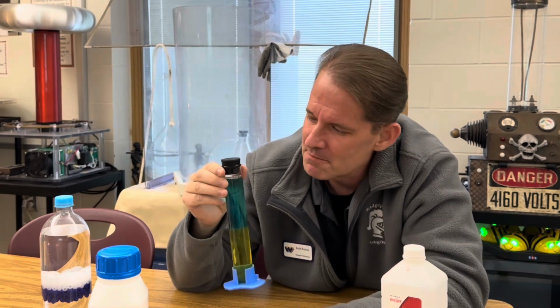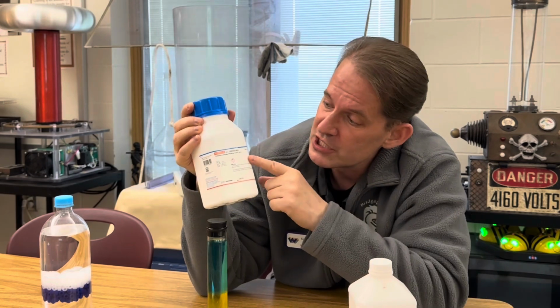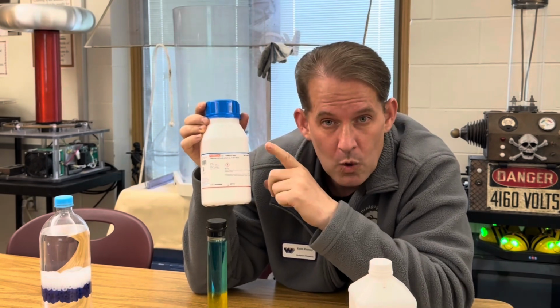Well, this is really a miscibility demonstration. That word kind of sounds like solubility, where if I have a solid solute and it dissolves in a liquid solvent, then I would say it's soluble. Well, what if the solute and the solvent are both liquids? That's where we use the term miscibility. So in this case, one liquid, isopropyl alcohol, is immiscible. It does not dissolve in my salt solution that was made with potassium carbonate and water.